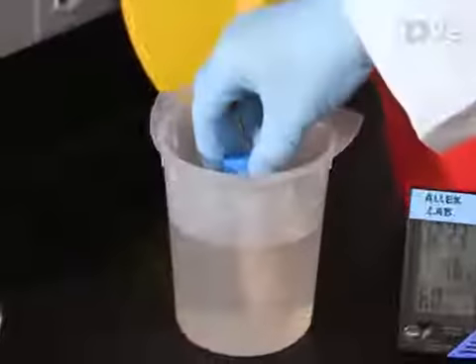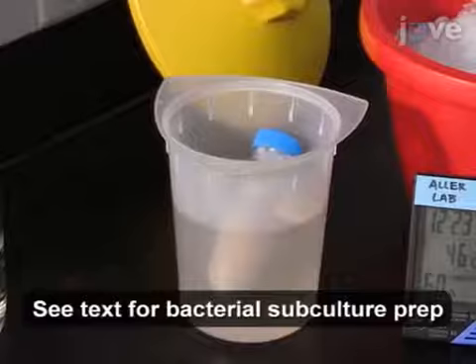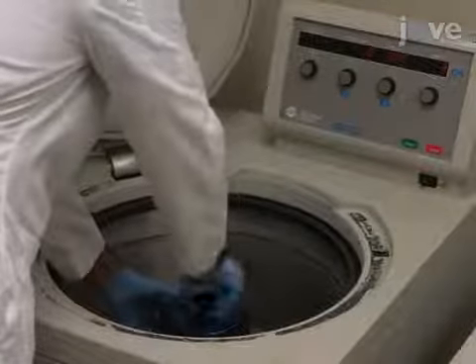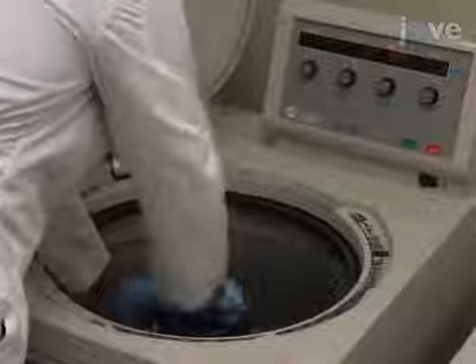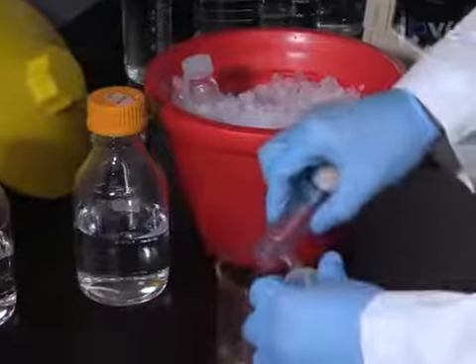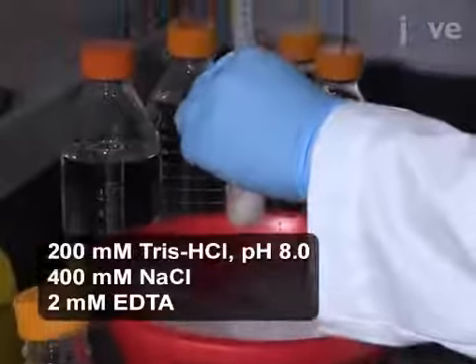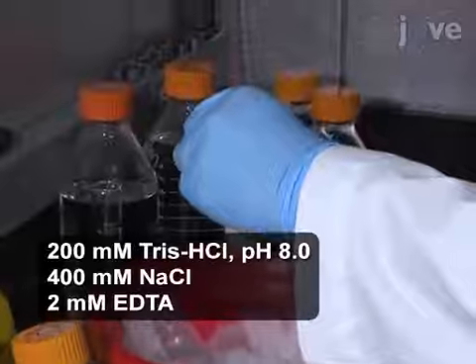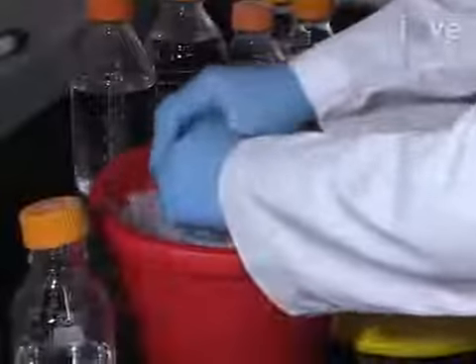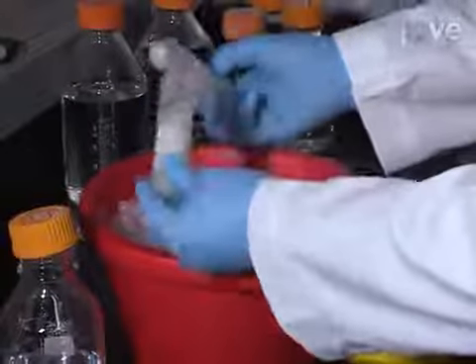First, thaw a previously prepared bacterial subculture resuspension at 4 degrees Celsius. Then, pellet the thawed cells at 4,000 times gravity for 20 minutes at 4 degrees Celsius. Next, resuspend the cells in 50 milliliters of ice-cold high-salt buffer by aspirating with an automated pipette and a 25 milliliter tip. Incubate the suspension over ice for 20 minutes, with occasional inversion for mixing.